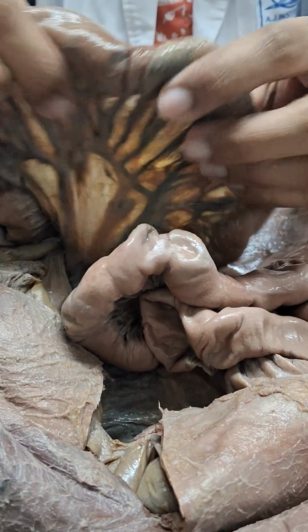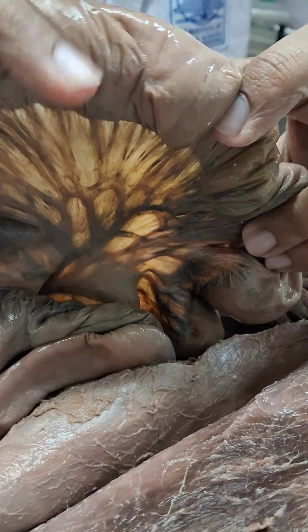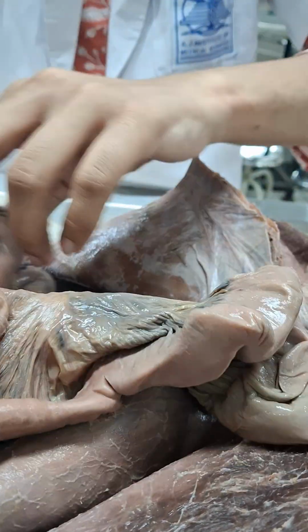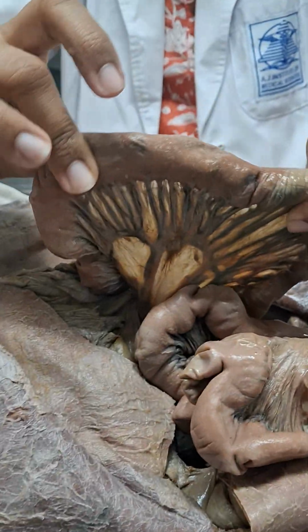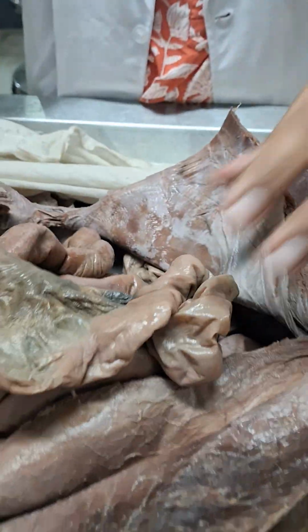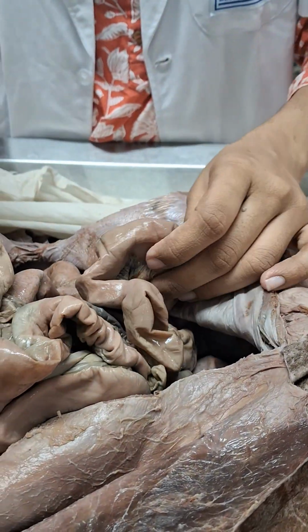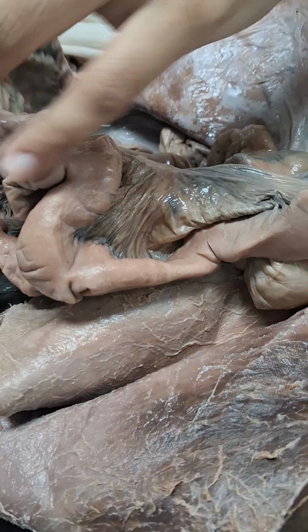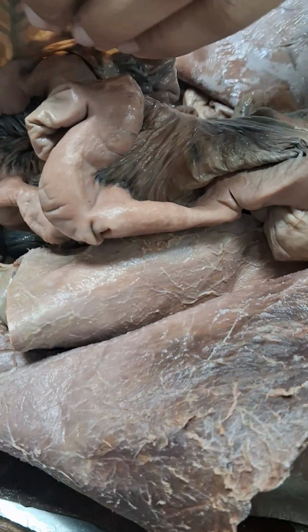Also, the windows are supposed to be closer here than they are in the ileum, but again, I don't know. Okay, there it is. There you can see that the windows are further apart than they were over here, but they are very crowded. Fat deposits are more in ileum. Ileum has more fat, yes, it progressively increases. It's fattier at the ileum. Fat is just there as a storage thing, not much significance, honestly. Storage and protection.